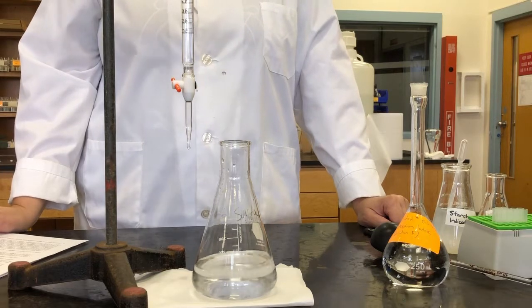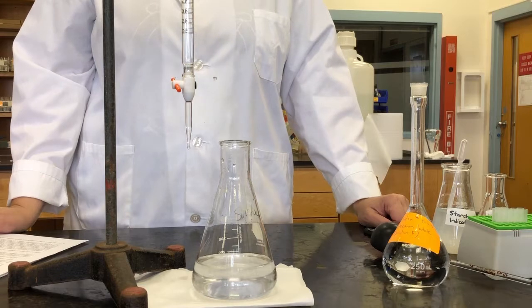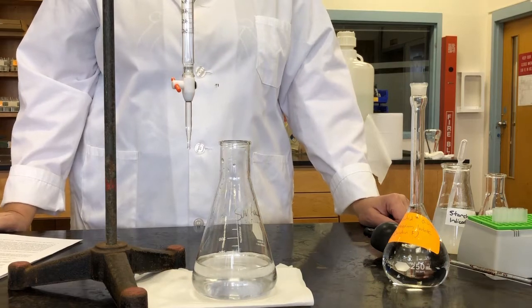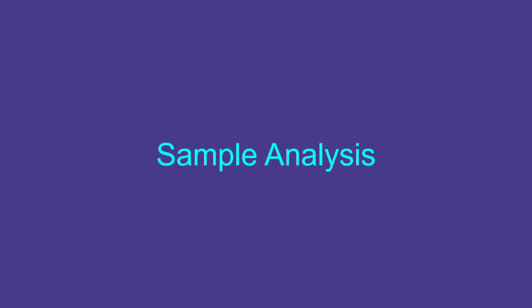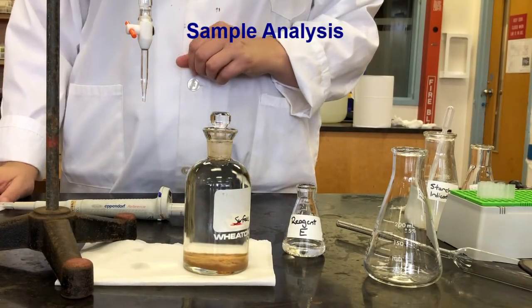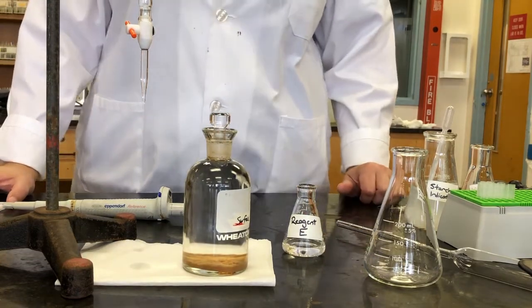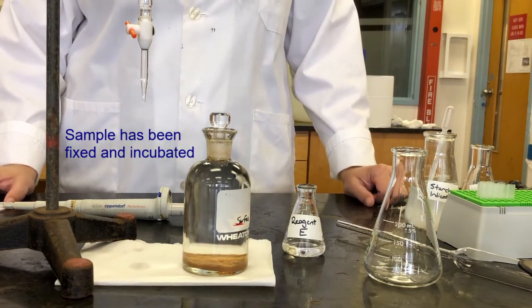So as in the last lab, we're going to do 3 of these titrations, and again, you will be provided with the results. So that's the standardization. Our next step is the analysis of the samples. Okay, so this is our sample, and again, that's a surface sample from Kent's Pond, so the same sample we used last week. So this has had the reagent A and B added to it, it's been incubated, and now it's been allowed to settle.